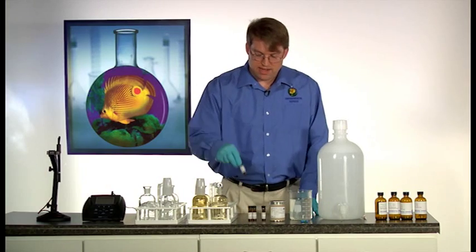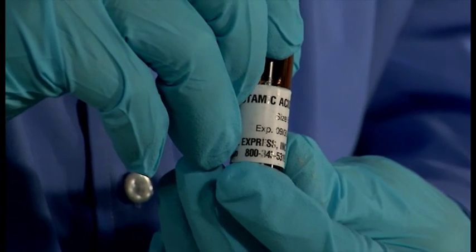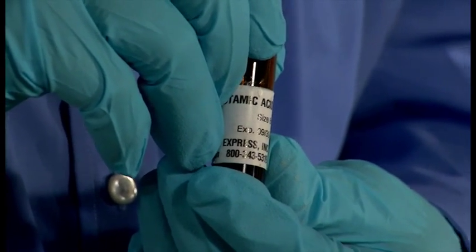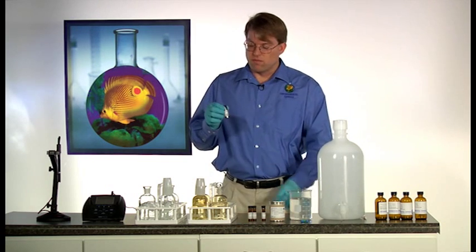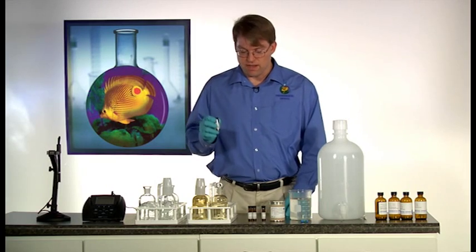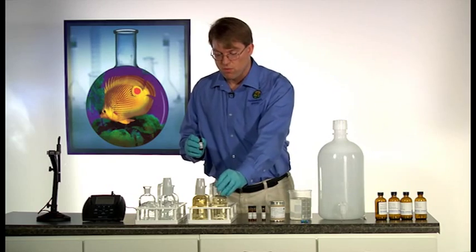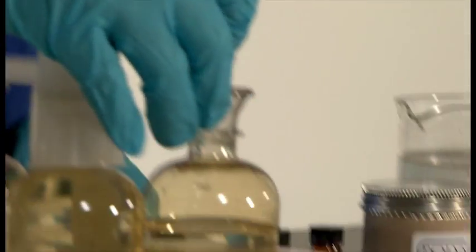The glucose and glutamic acid check standard is the primary measure for precision and accuracy of a BOD batch. For ease of use, prepared vials with the appropriate amount of glucose and glutamic acid are recommended. Simply uncap the vial and pour the contents directly into your BOD bottle.